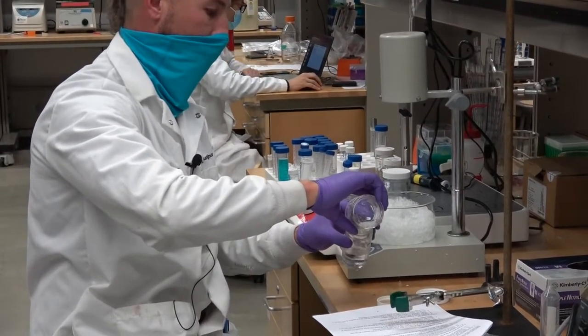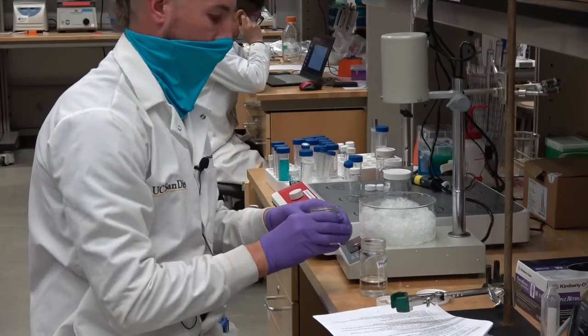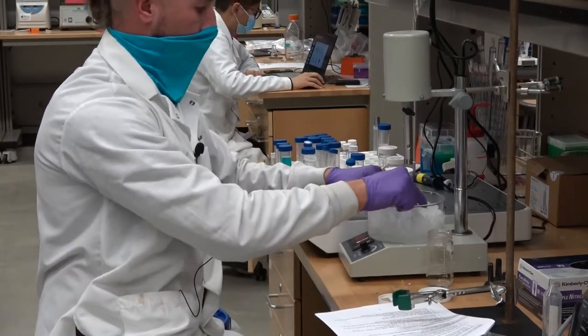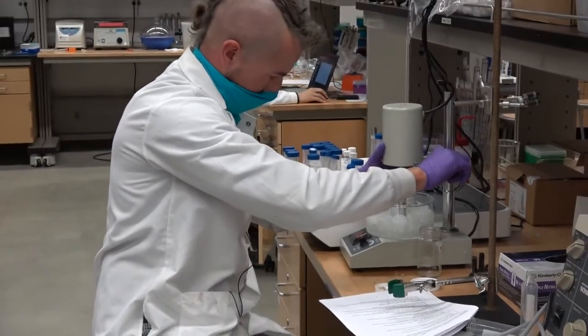Try not to get the stir bar. Okay, and then this is going to come down.